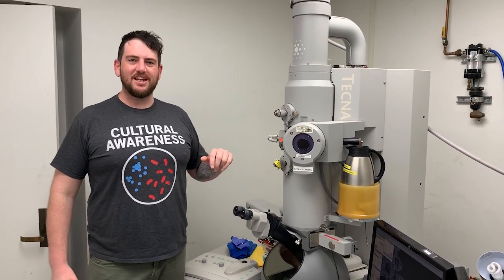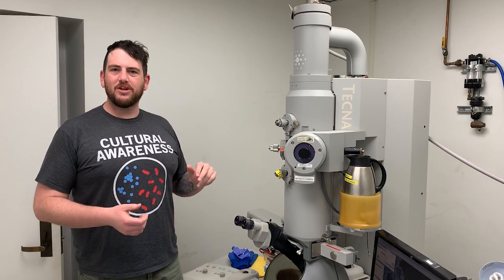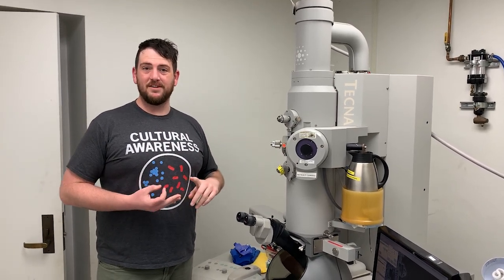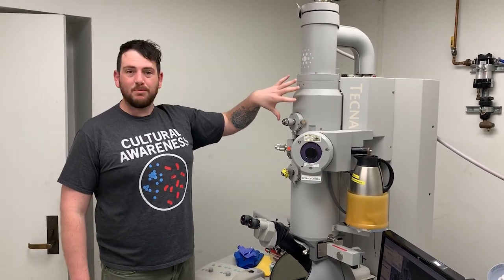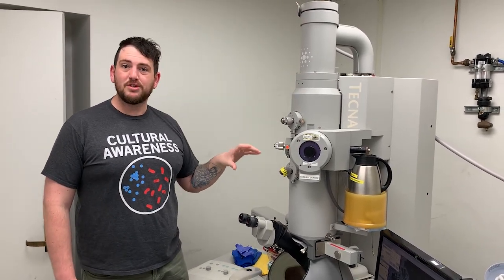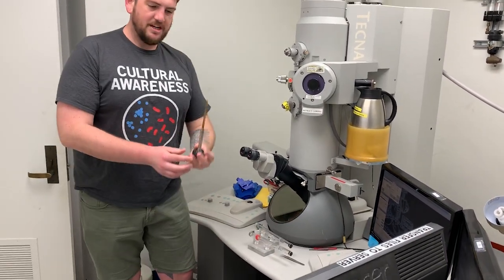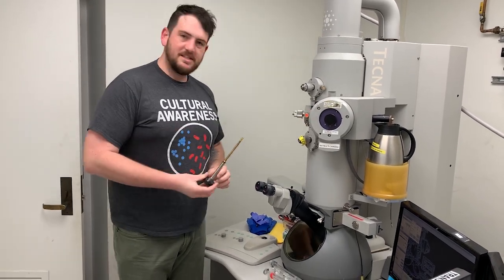Hi, I'm David Collins. I'm a PhD candidate here at San Diego State, and this is a transmission electron microscope. We use this microscope to look at small particles, proteins, and within the inside of cells. Electrons are generated at the top of the scope and they're focused into a beam which then passes through your sample. Your sample is loaded on a specimen rod which is inserted inside of the microscope in the center of the beam.